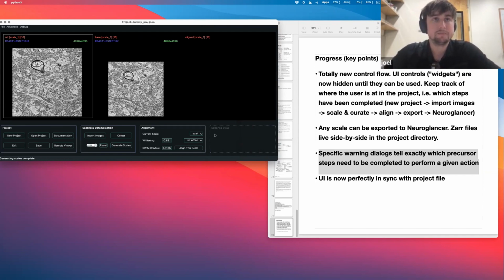We get these controls. There's a little alignment bug here, ironically, an alignment bug with this, but this is going to be your scale. I generated 2 scales so that if you could see here, it would say scale 1 and scale 4. So we're going to do an init affine and align this scale. Should be pretty fast.